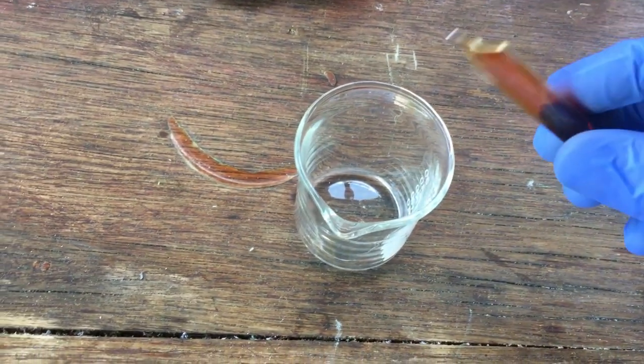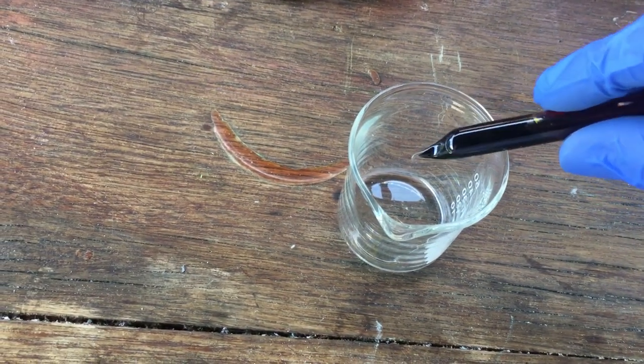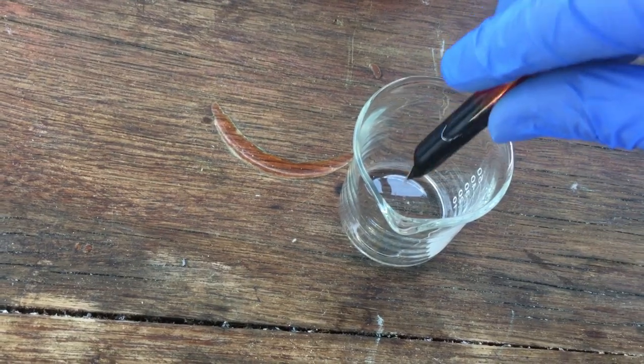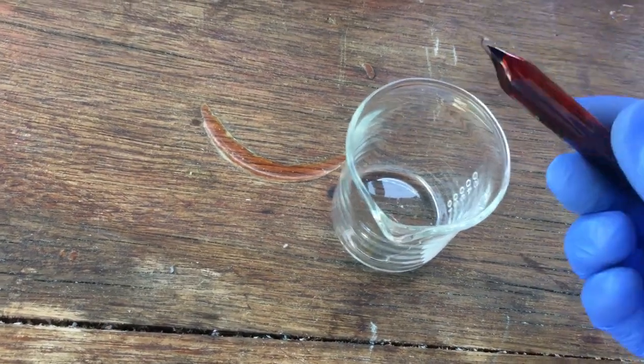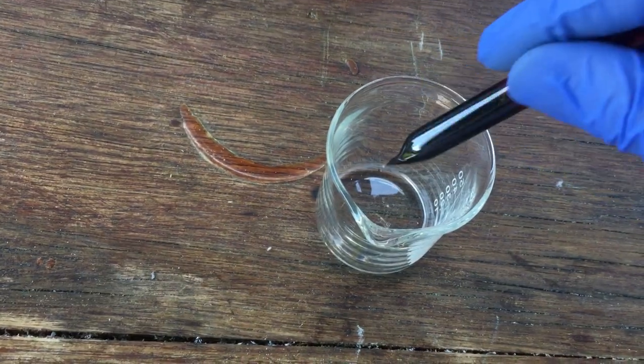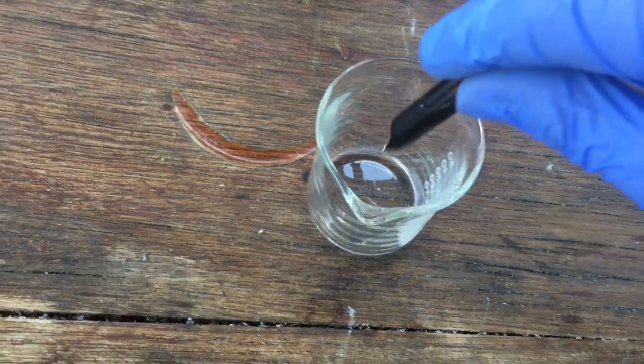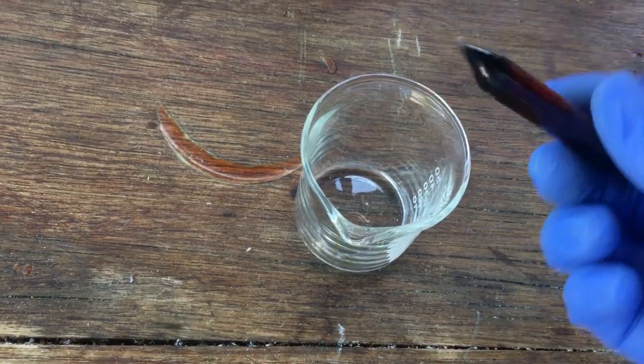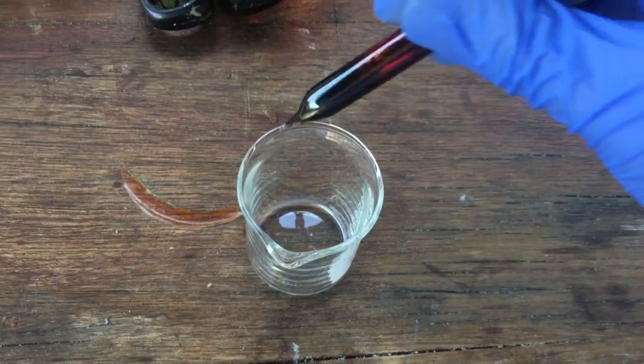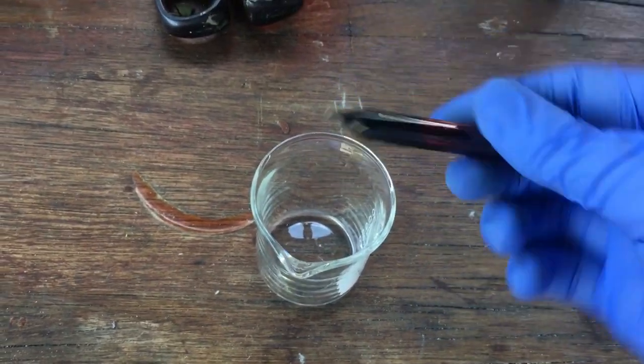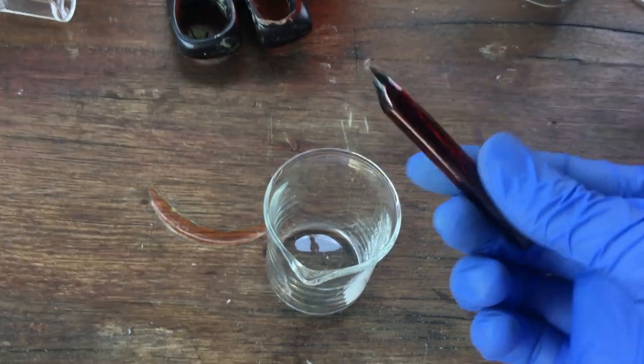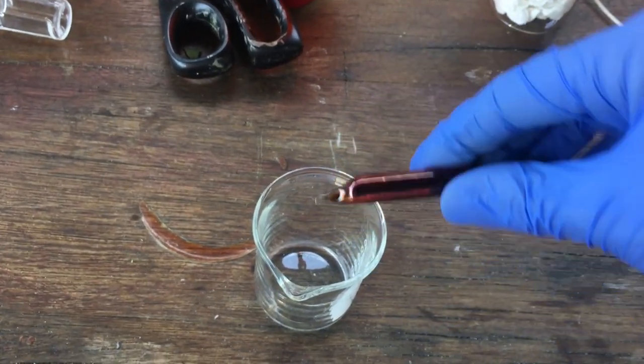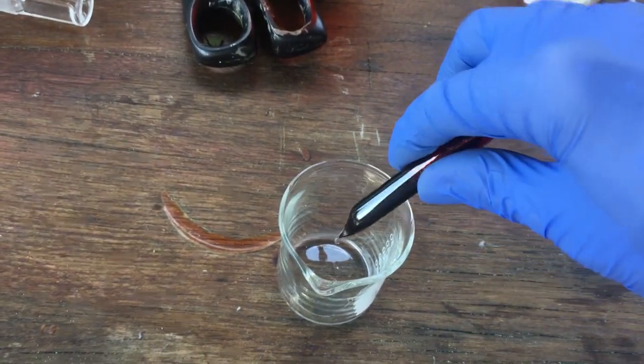Alright, let's test it again. That's looking promising. Excellent. Just doing this, I can feel just how heavy the bromine is, because it is three times as heavy as water, and you can really feel that sloshing it around like this.